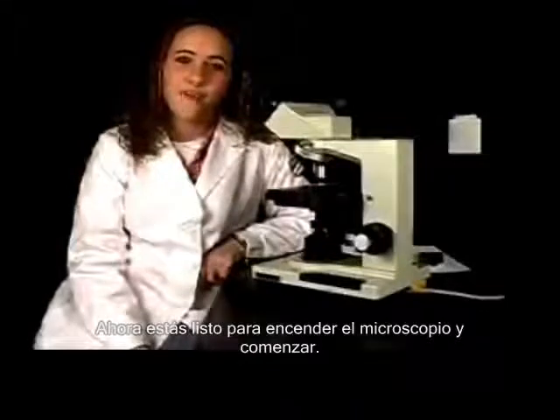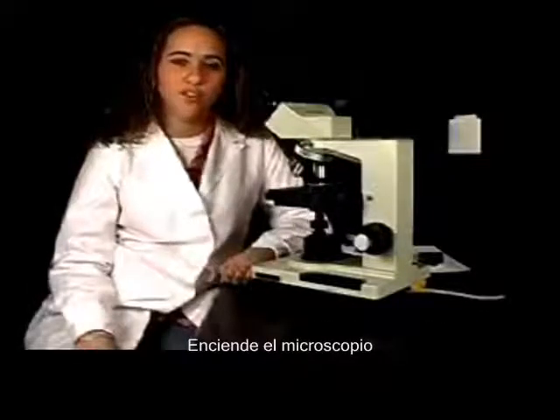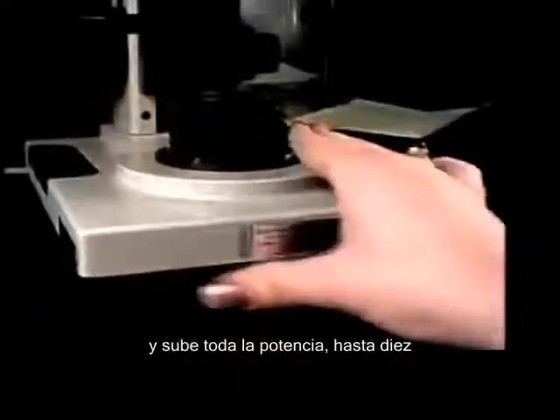Now we are ready to turn on the microscope and begin. Turn on your microscope and raise the rheostat all the way to 10.